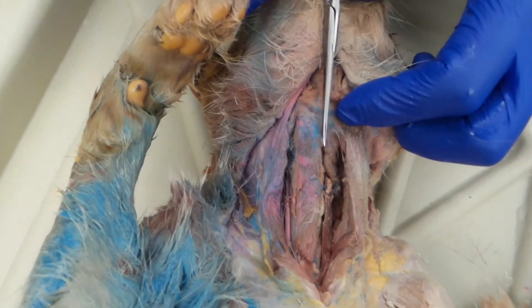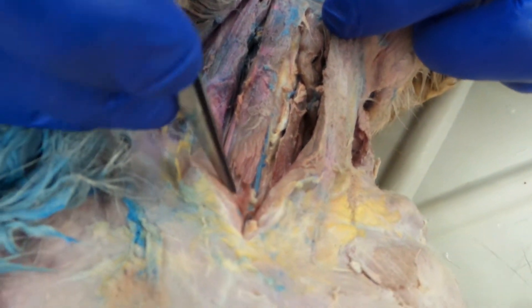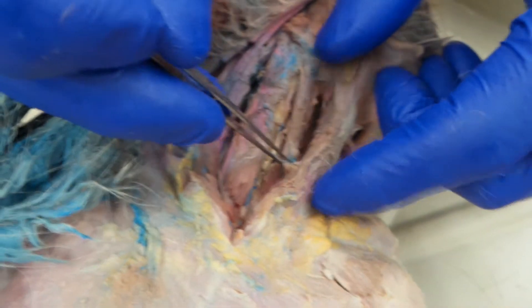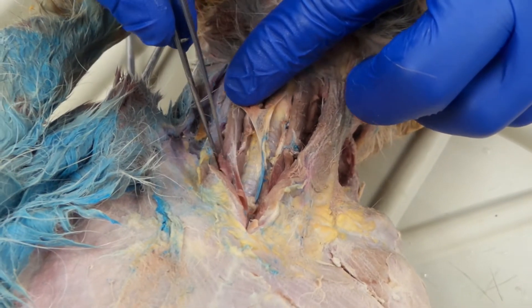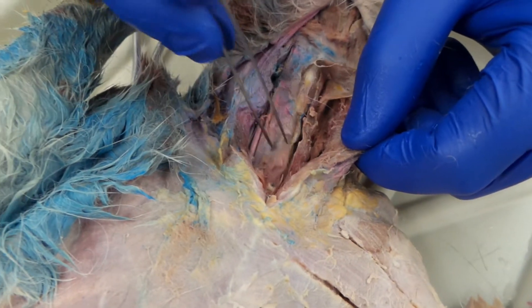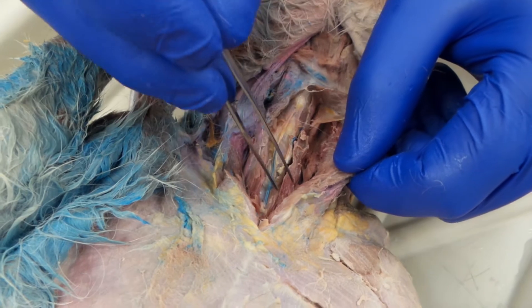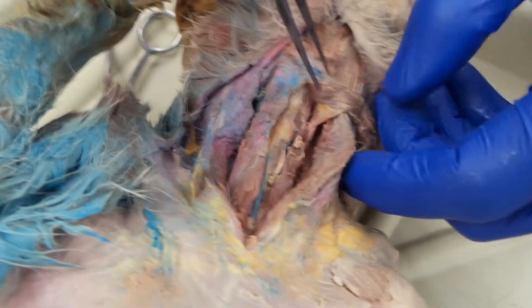This has been pre-dissected. I kind of went down along here, and what we're looking at almost immediately on the right side here is the sternohyoid. Here's the sternohyoid on the left-hand side. Under the sternohyoid — and this one's been torn — is the sternothyroid. So we have sternohyoid, which runs clear on up here, and we have the sternothyroid that runs and ends right here, below the hyoid.